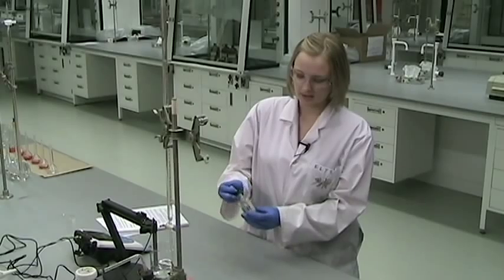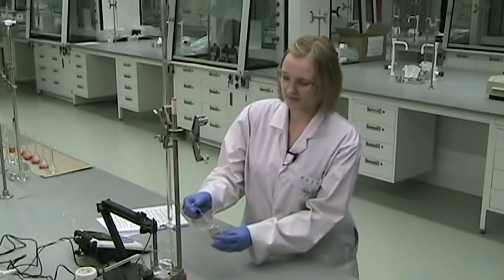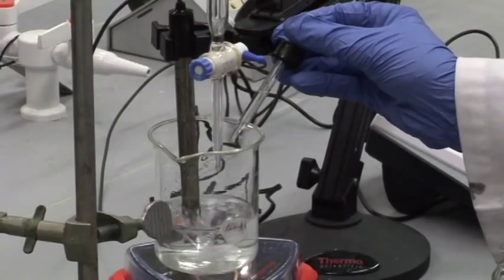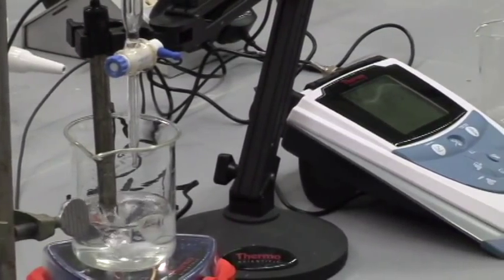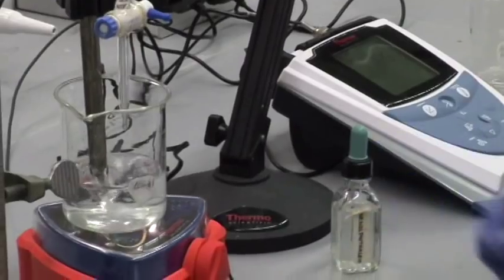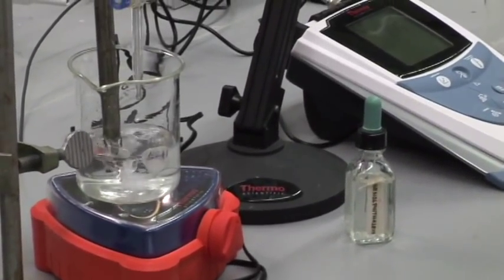Before you begin, you'll also need to add some indicator. Just two or three drops is enough. In this case, I'm just adding phenolphthalein, which is colorless in acidic solution, as you can see, nothing happened. But once we reach basic pH, it will turn to a pink-purple color.